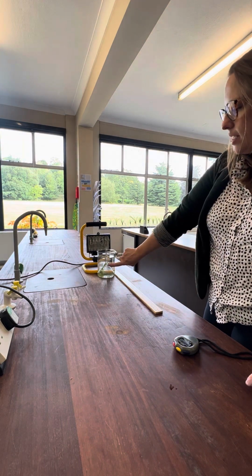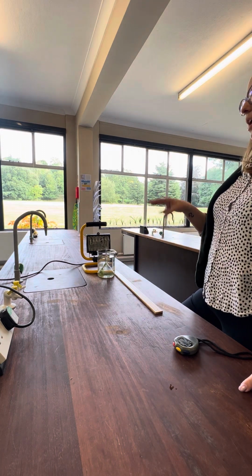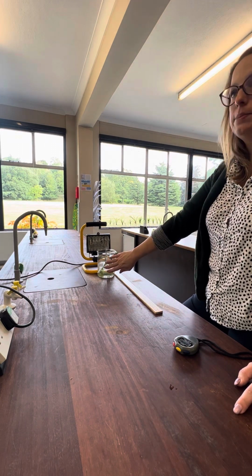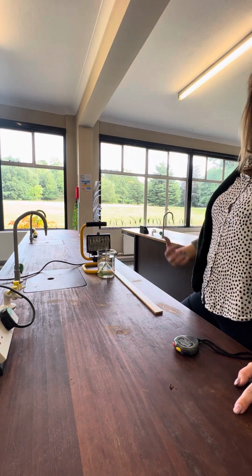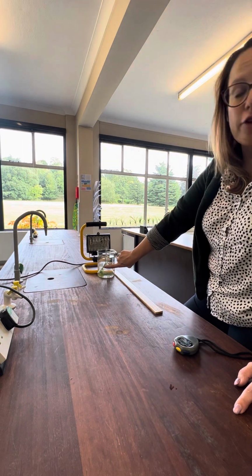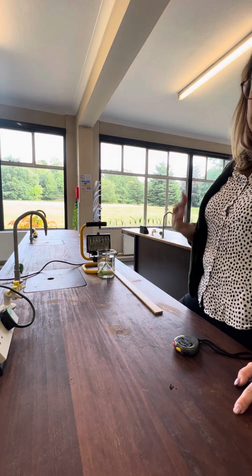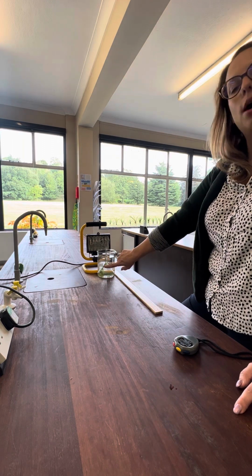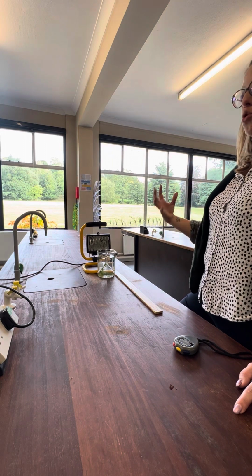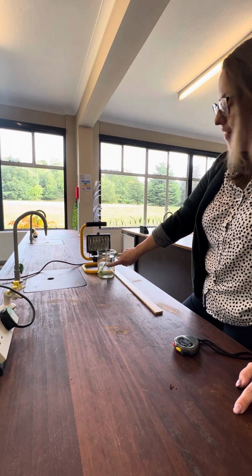Now, I said at the start that this needs to be in solution. My control variables for this investigation are the temperature of the room or the temperature of the solution, which is going to be the same. But I'm also going to control the volume of water and the volume of carbon dioxide, which I am going to get from this solution. So this solution is actually sodium hydrogen carbonate, which contains my carbon dioxide, and it's a set concentration. So I know exactly how much carbon dioxide is in here, and I know exactly how much water is in here. So I am controlling the concentration of carbon dioxide and water, but I'm also controlling the volume because I have a standard volume.